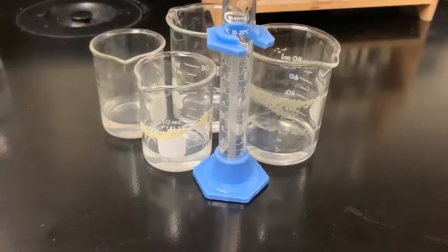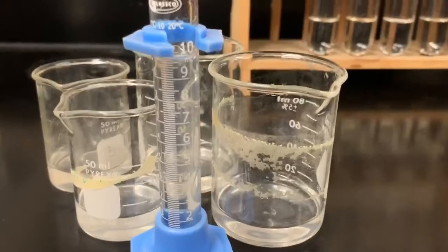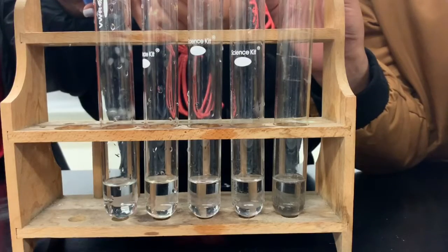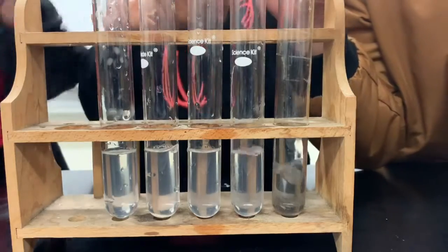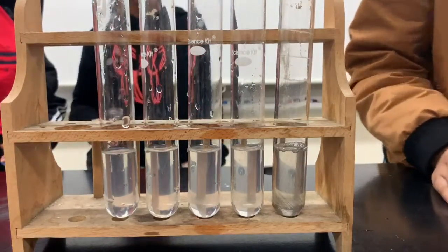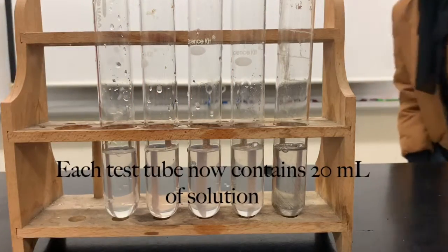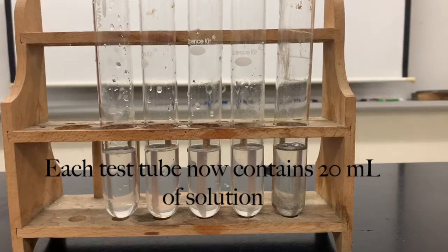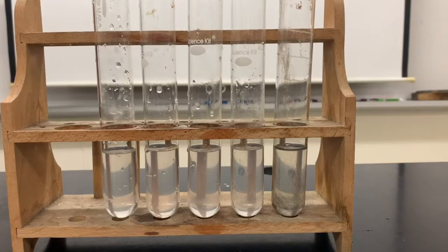Have the reacting species on standby and give a verbal count so that solution B can be poured at the same time. Have one member recording the time each reaction occurs. This individual should also be responsible for recording data during the procedure. Watch the reaction go to completion and use the recorded and written observations to make calculations on the relationship between concentration and the rate of reaction.